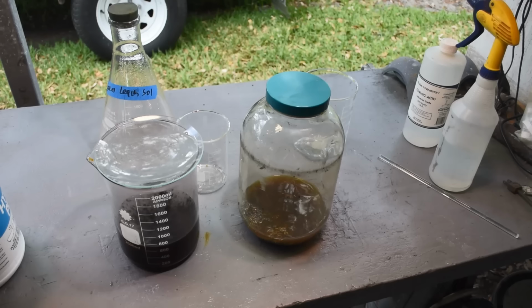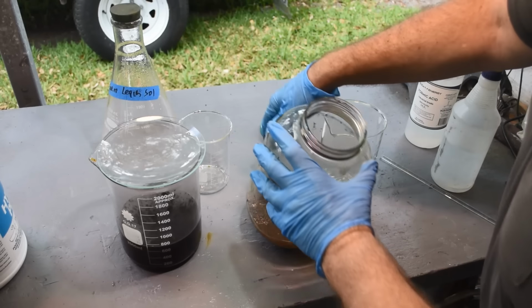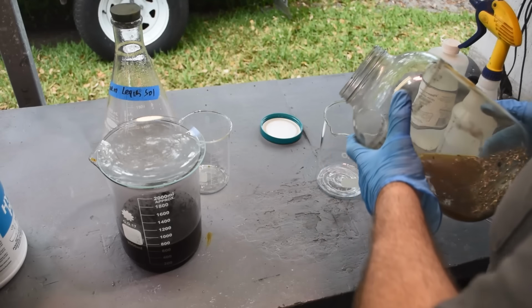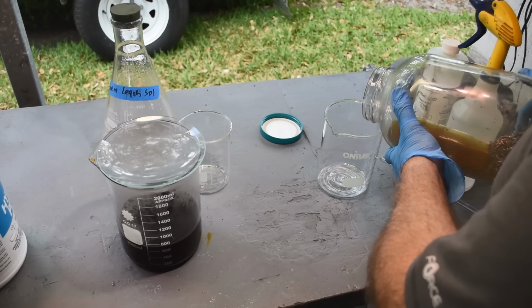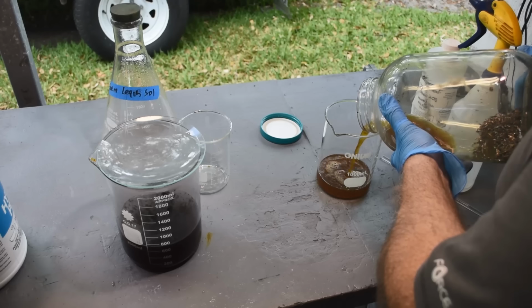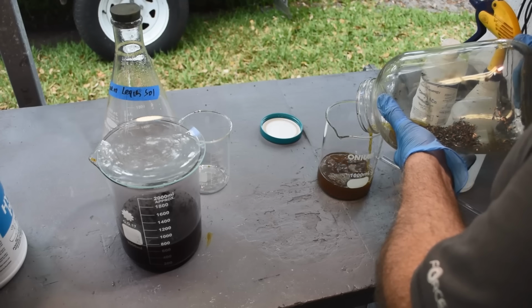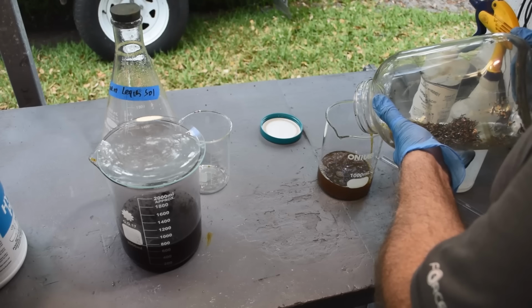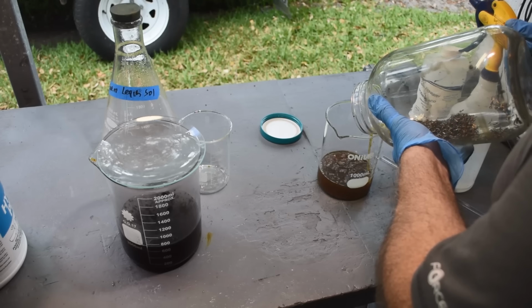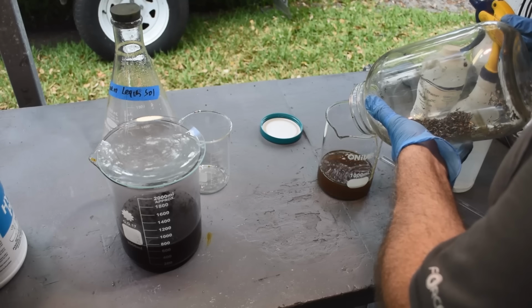All right, so after 15 minutes, the liquid is starting to turn a muddy brown, but it hasn't gone too far that direction yet. I know if I leave the liquid on these pins for too long, it will start looking like coffee with way too much creamer in it. It's only slightly muddy brown and no longer purple.